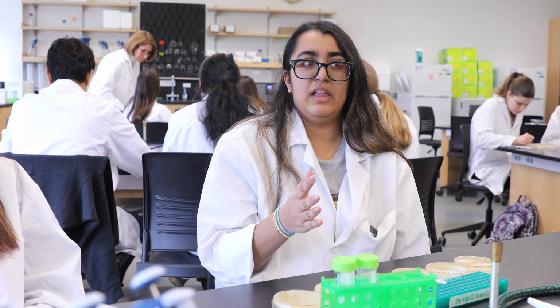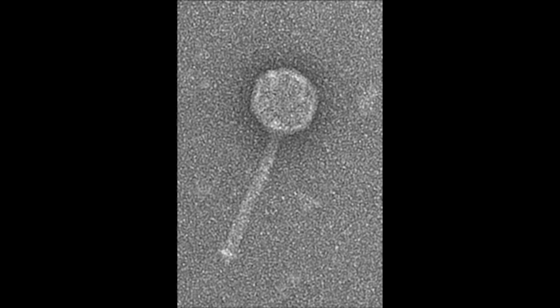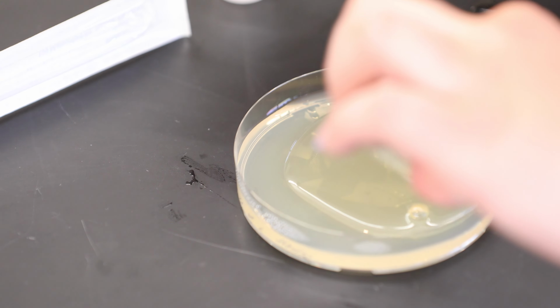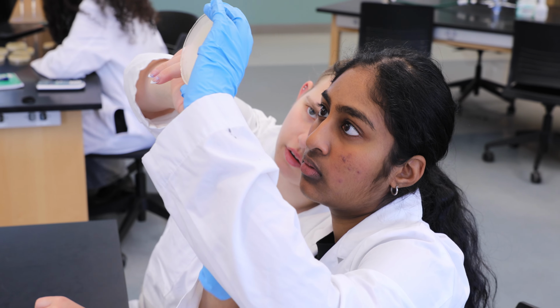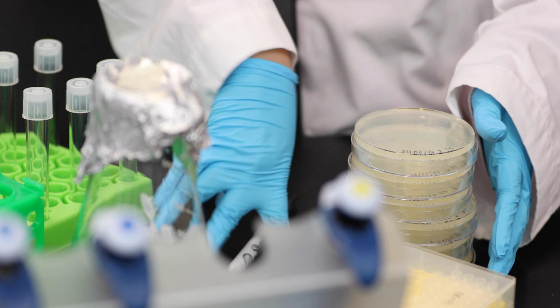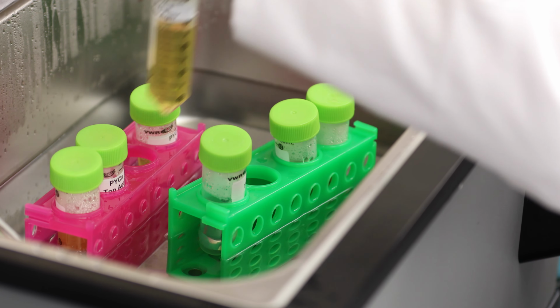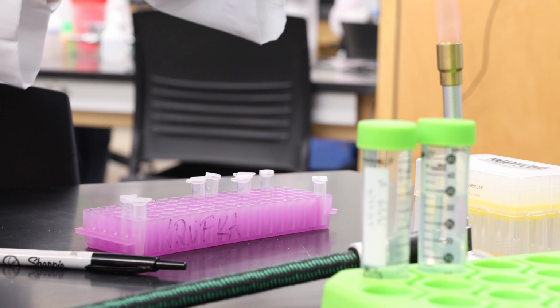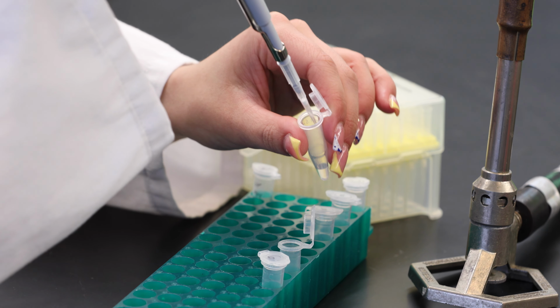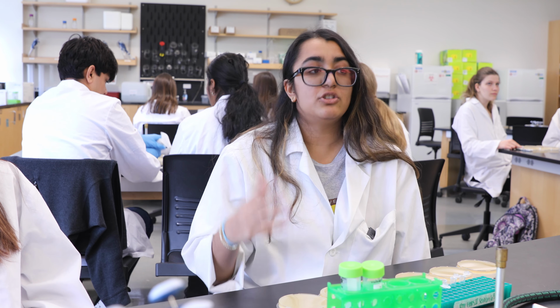Phages kind of border the line between living organisms and not. We went out and collected soil and mixed it with this host bacteria to see if there were these microorganisms called phages. They inject their DNA into bacteria like our host and use it to grow and replicate. The clinical applications of phages, for example, would be phage therapy, which is a treatment for bacterial infections where we use a group of phages to infect the bacteria in a person and destroy that bacteria.